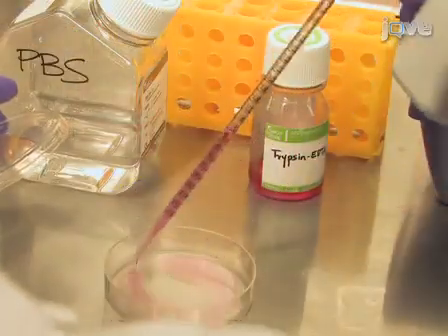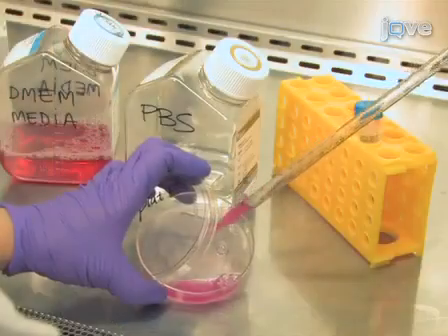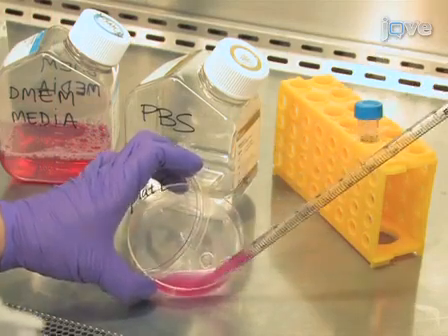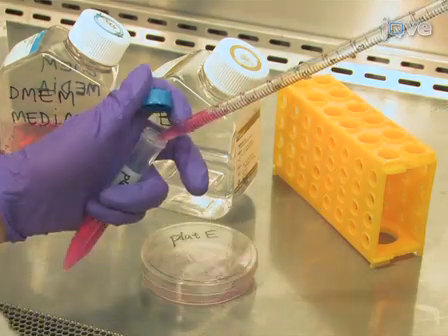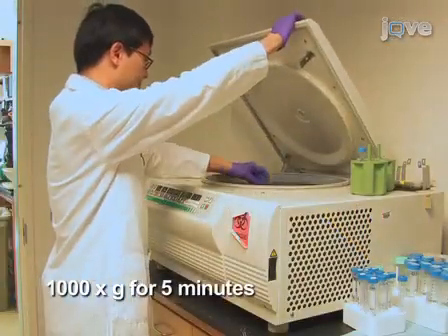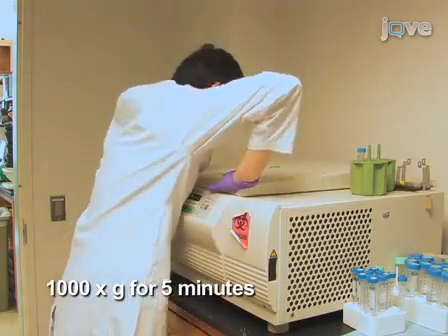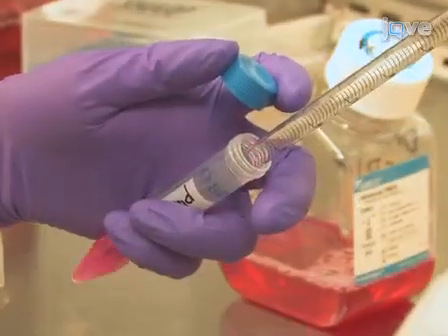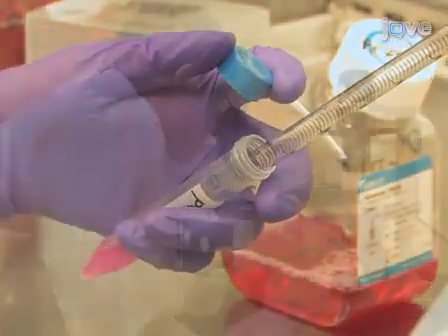Dislodge the cells by adding trypsin EDTA and incubate at 37 degrees Celsius for a few minutes. Neutralize the dislodged cells with DMEM media and transfer to a falcon tube. Next, centrifuge the cells at 1000 times G for 5 minutes. Aspirate the supernatant and resuspend the cell pellet in DMEM media.